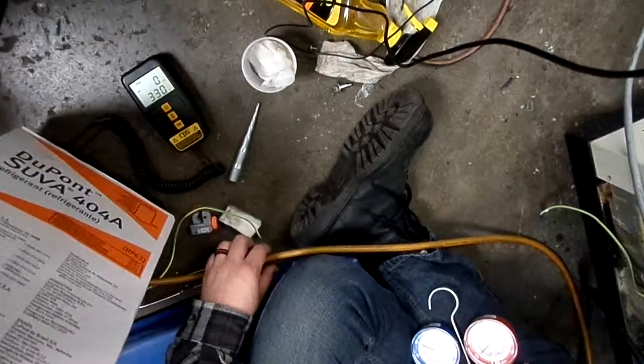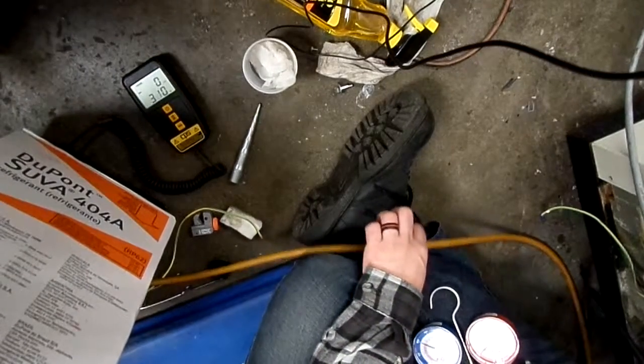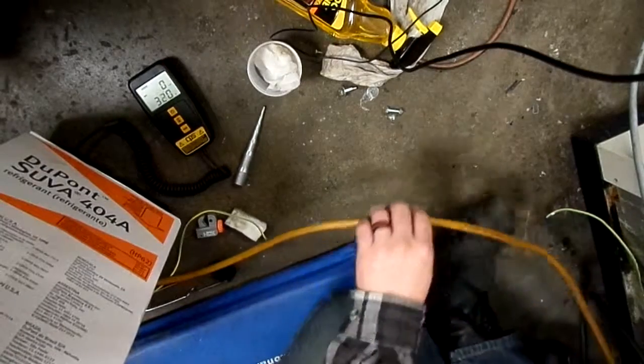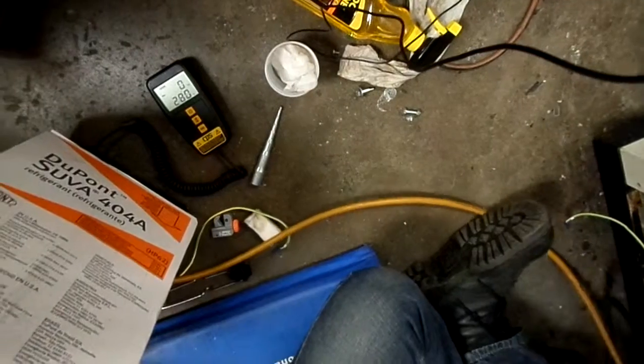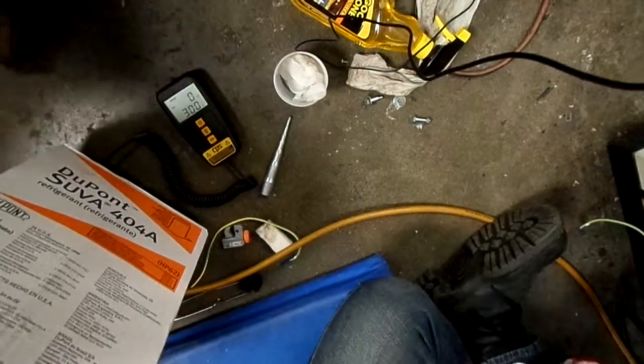Typically, yeah, because I moved and the hose is on top of me. Don't put the hose on anything because it's a very sensitive scale. Just kind of let it set free. Try not to move your gauges around too much while you're doing it too, because it'll throw off this guy.